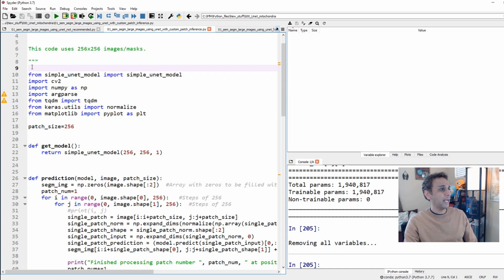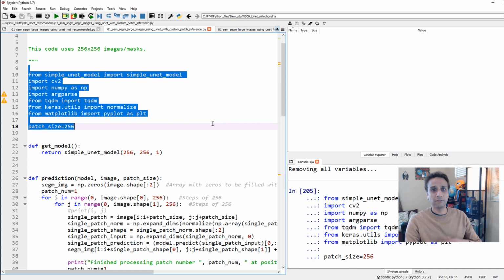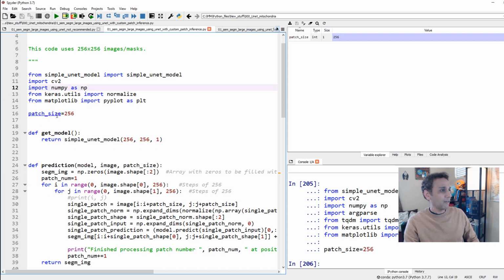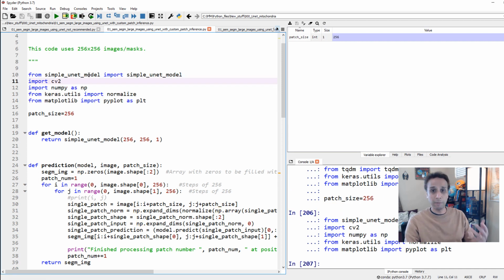So let's go ahead and import. And again, these are all standard libraries. In fact, I'm not even using some of these, they're just for tracking the flow of it. Okay, let me keep this simple. So here, all the libraries you should be familiar with. And the first line is basically my file that I have with my model in it, right? So the simple unet model and OpenCV, NumPy, and everything.